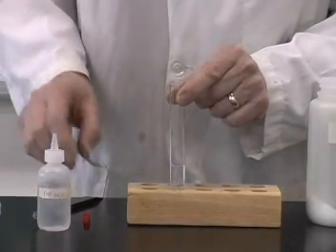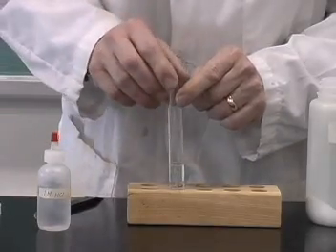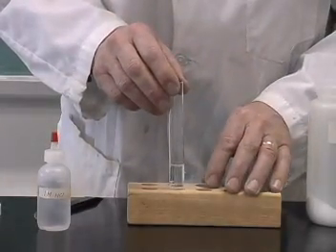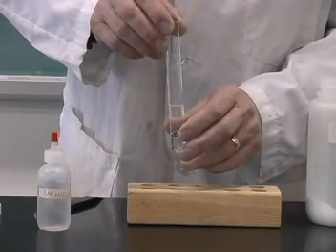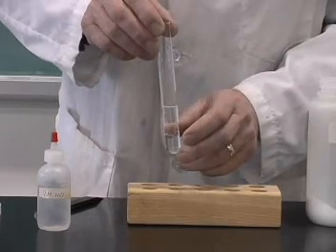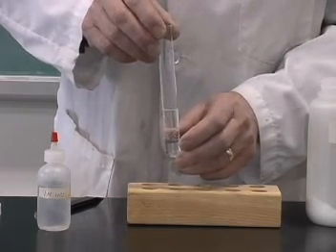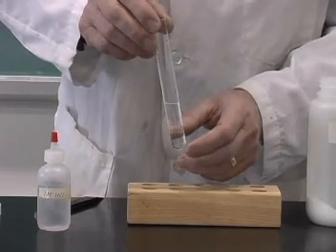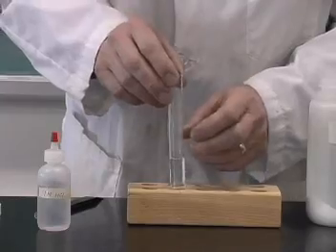Is that now a chemical or a physical change? Well, obviously, we're forming a new substance. In this case, a gas is being generated, and that gas is a new product, and hence this is an example of a chemical reaction. What is this gas? Well, let's see if we can do a test for it.